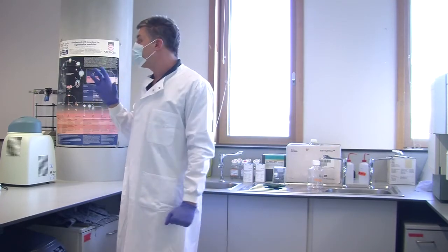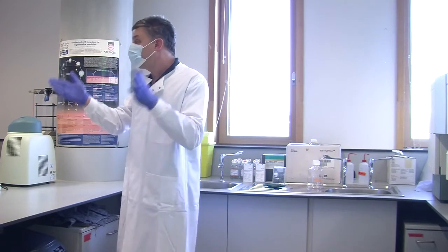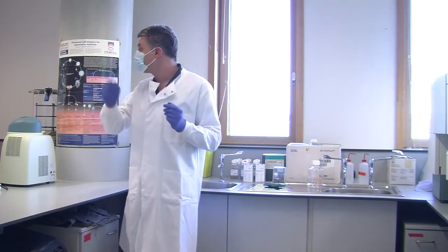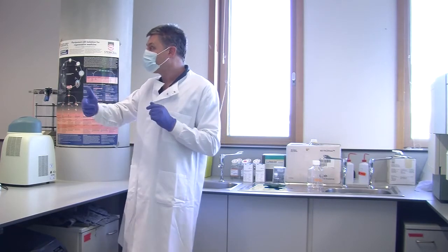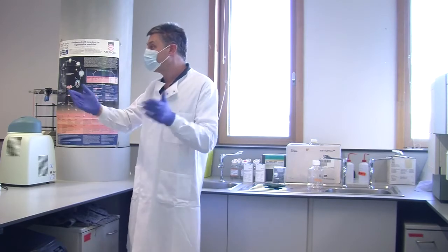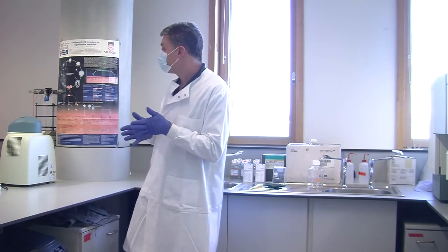So what we would be able to do with that is run all 3 samples each tube, we'd put all 15 tubes on, I'd click go, and then I'd stand back and talk to you while it's running all 15 tubes. Then it would output all of your data in a standard template format, and I'd click print, and we'd have PDFs, and I could hand them out to you, and it'd have all the analysis done while I was talking, which is nice.